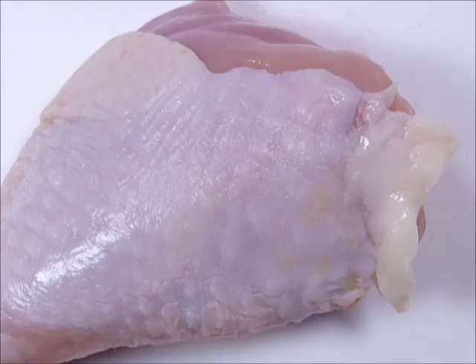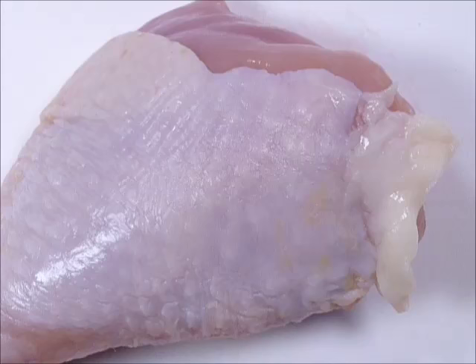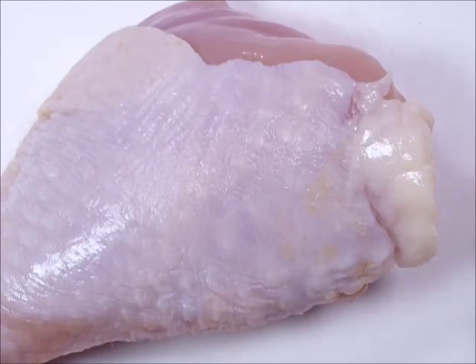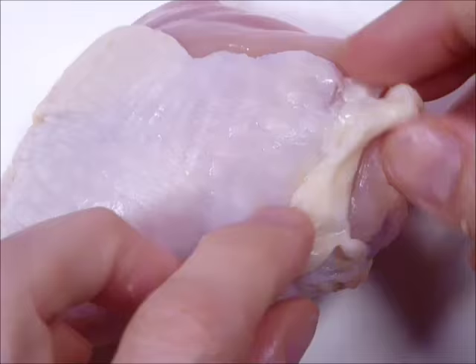Let's start by looking for adipose tissue. This is the easiest one because it's often yellow. Right here I see some yellow — it's not bright yellow, but in comparison to other pieces it's fairly yellowy. I don't have a microscopic view, but I'm going to assume this is some adipose tissue.